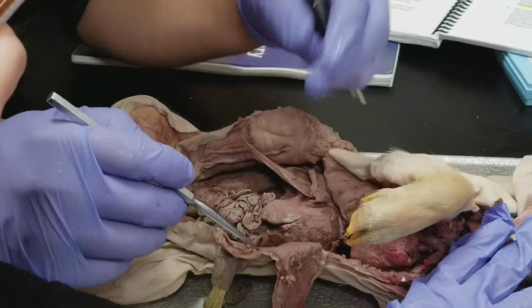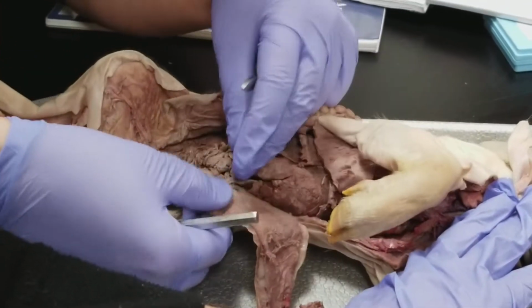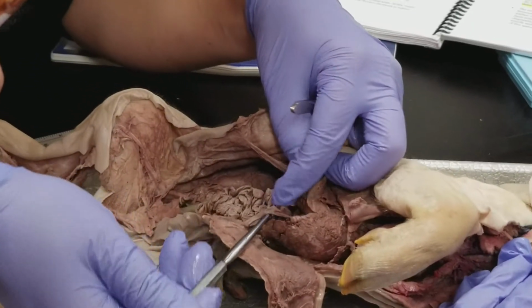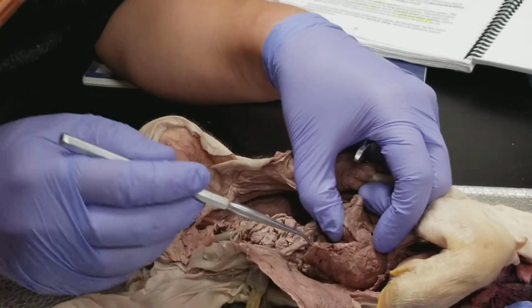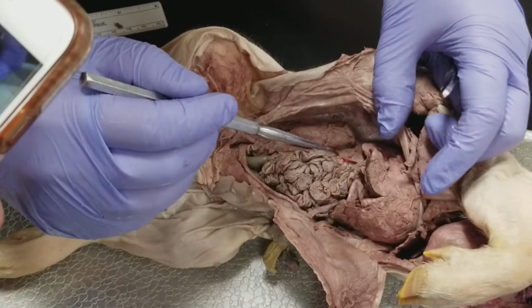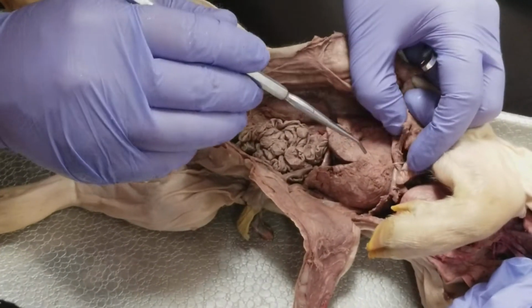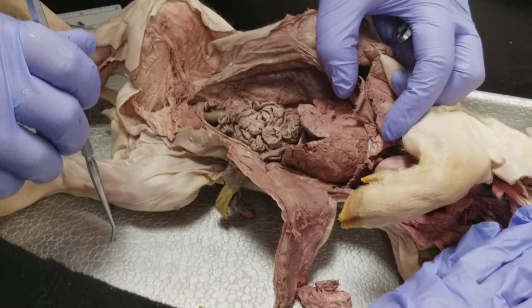The other structure that we can see here is the umbilical vein. So there's two umbilical arteries, one umbilical vein, and the umbilical vein, which on this guy is gigantic, you can see. Remember, it is carrying all the oxygenated blood from the placenta, and it's heading up this way to eventually join with the inferior vena cava on the way to the heart. We lose it as it goes to the liver, and because those livers are falling apart, we can't get a good look at it. Anything else?